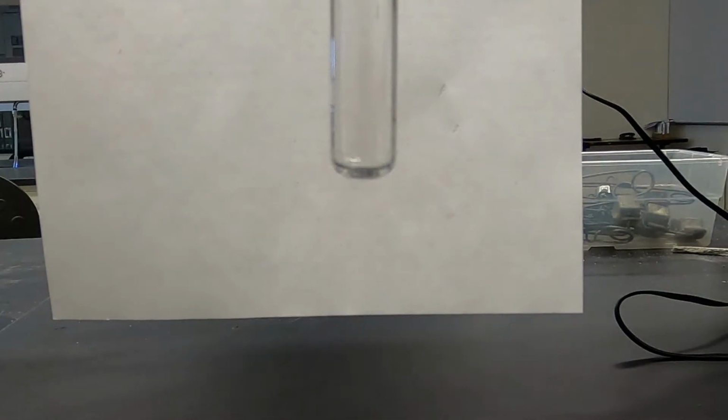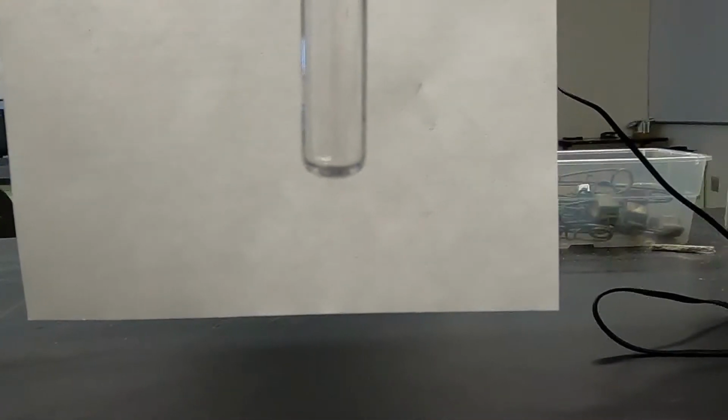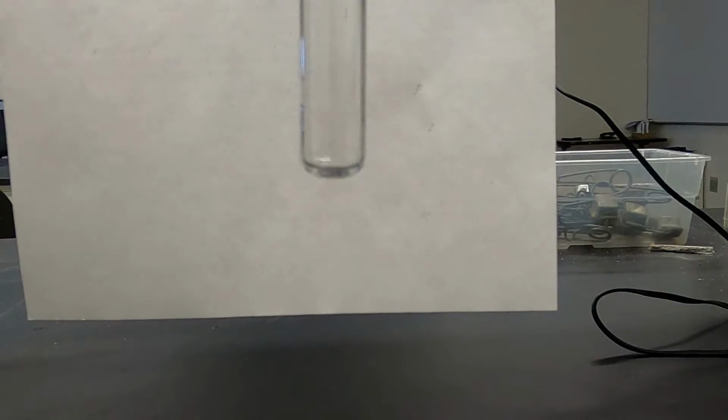Welcome to Lab 10, Chem 121. My part of this is going to be short and fast. All I have to do is mix some solutions in test tubes and let you look at the reaction that occurs or does not occur. And the hard part is on you on this lab and your instructor, who has to find a way to talk to you at a long distance.